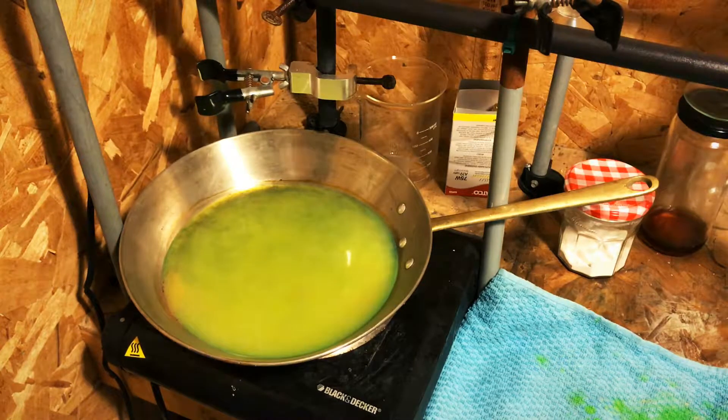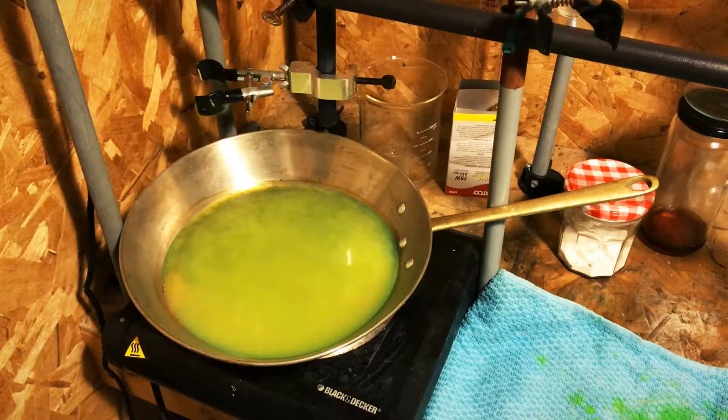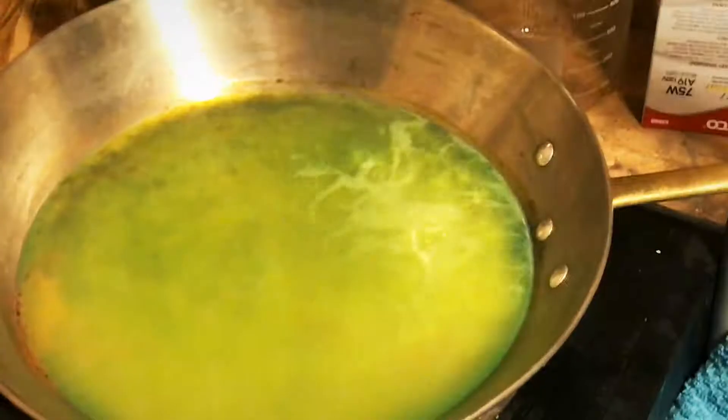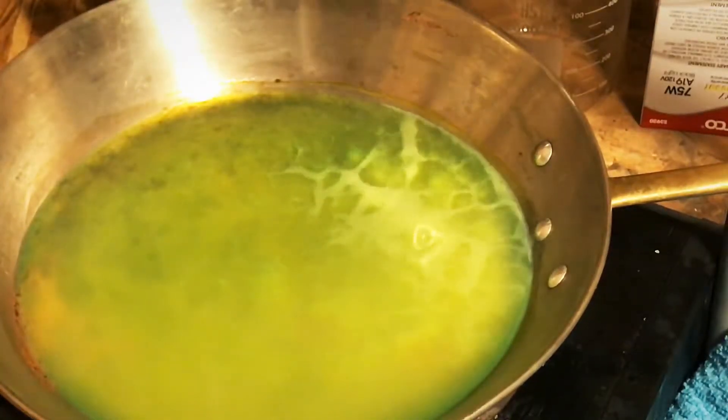As the alcohol evaporates, the fluorescein is going to, in essence, come out of the solution.